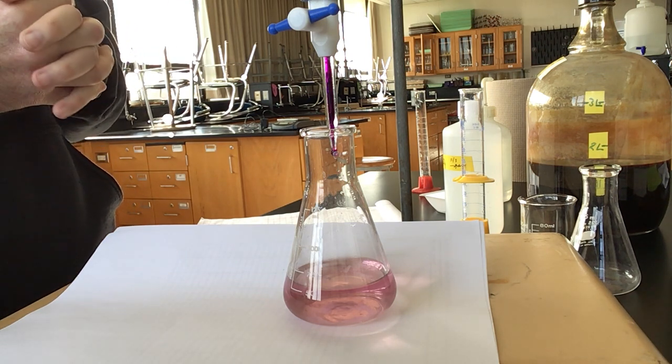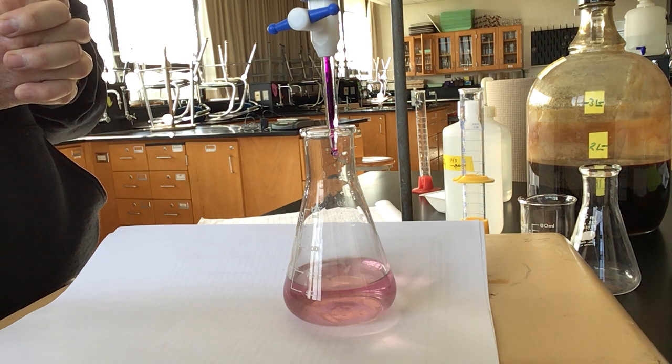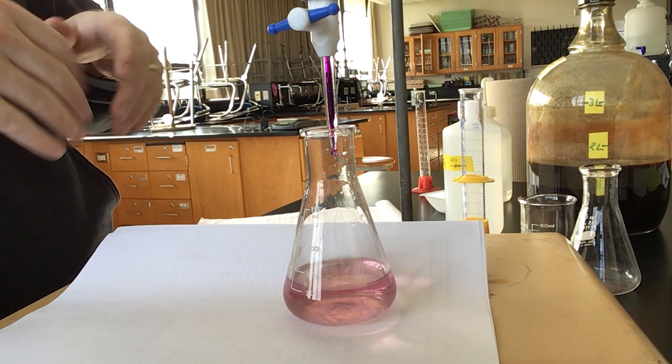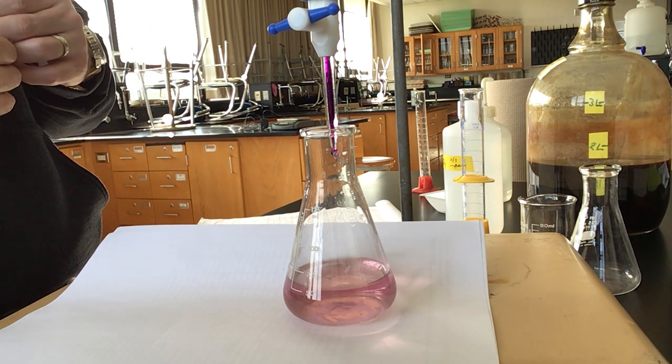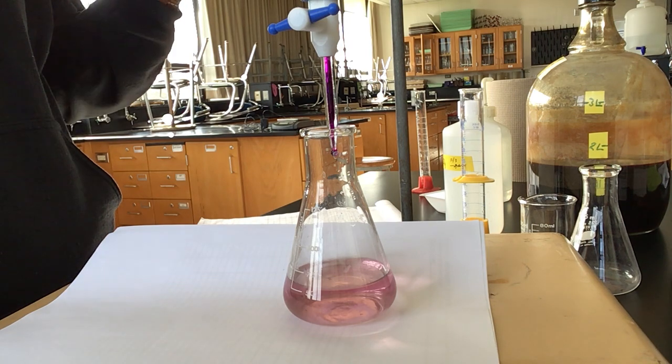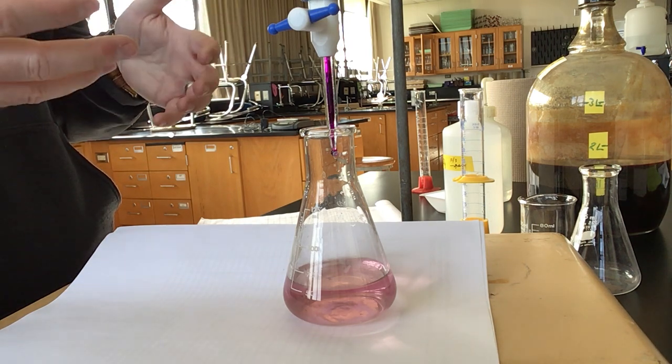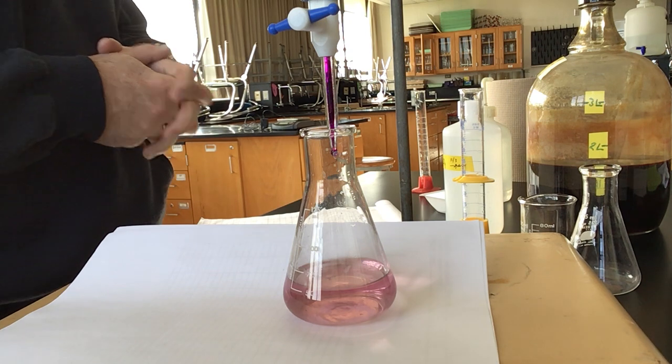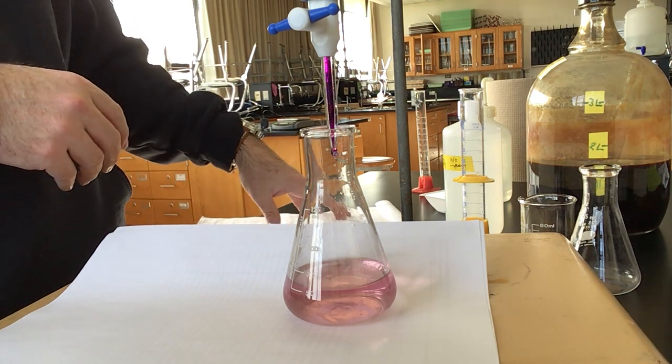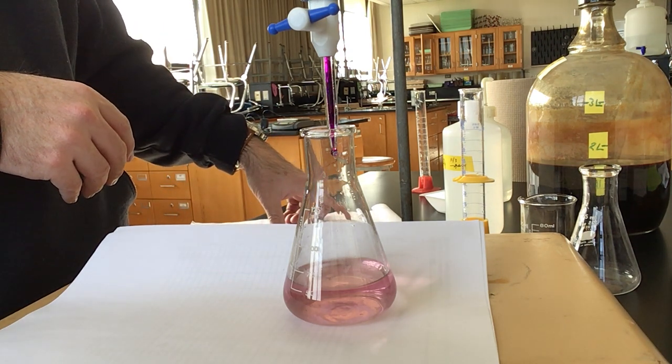Typical standardization, what you would do is you would then maybe do multiple trials if you were doing this yourself. Sometimes as a class, you would take the class data, take one good trial from the class data. Again, for your calculations, if you wanted to, we can take a look at it.